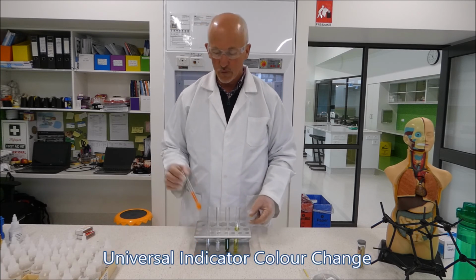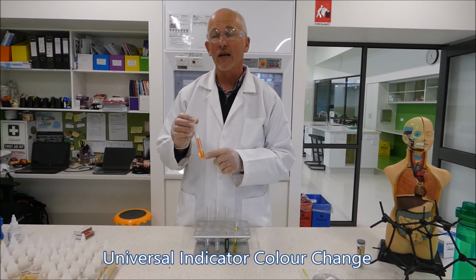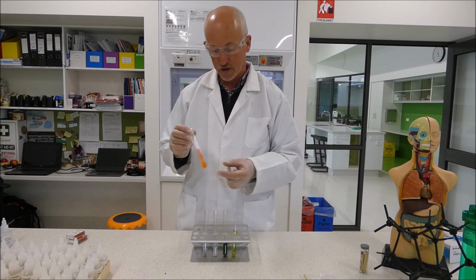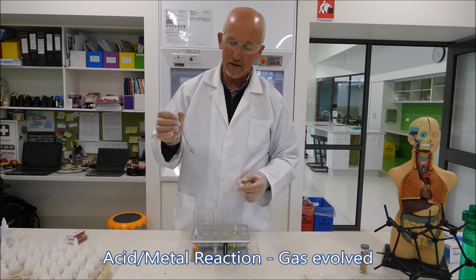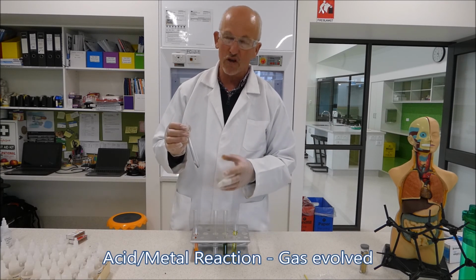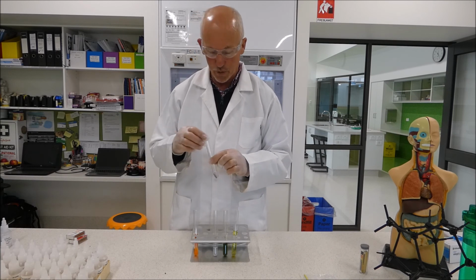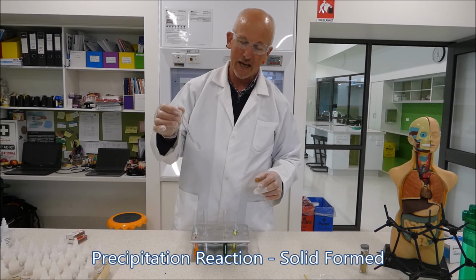Now, in our experiments, we did a colour change reaction to start off with, where we added a yellow indicator paper, universal indicator paper, to acid, and we observed a colour change, and that's for you guys to put into your tables and to record and to talk about. We then did an acid metal reaction where we had a gas being formed, and the gas could be observed by the bubbles forming, by the smell of the gas, and also by something called a pop test, which tests for a flammable gas. We then had a precipitation reaction, and the precipitation reaction formed a solid.